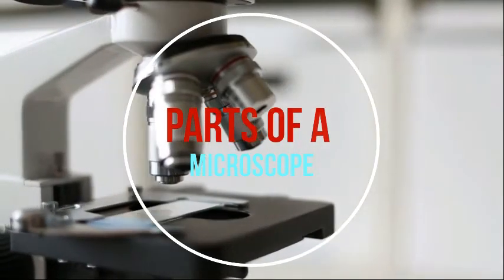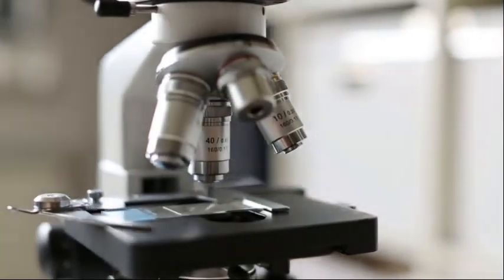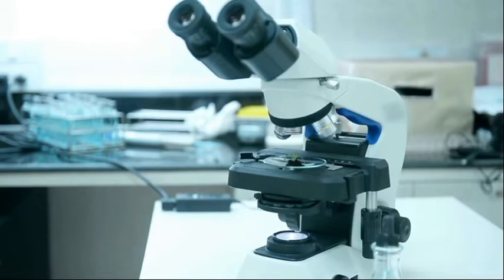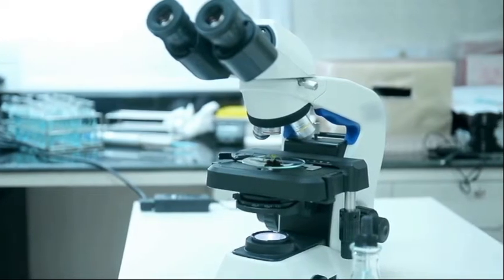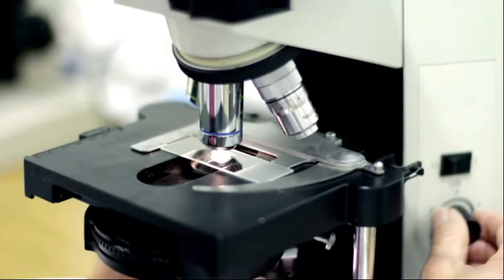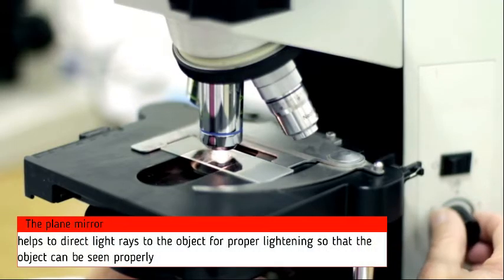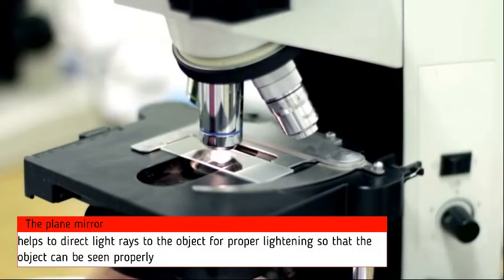Now, what are the parts of a microscope? It's important for us to learn the parts of a microscope because it will help us know how to operate it when we have one in front of us. I'm going to list the parts, and after listing them we're going to go through a scenario on how to use it. The parts include the plane mirror — the plane mirror helps to direct light rays to the objects for proper lighting.